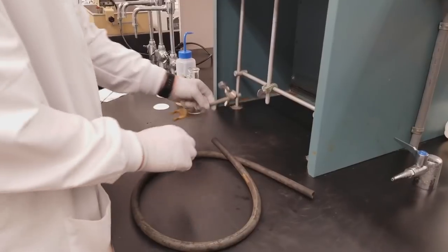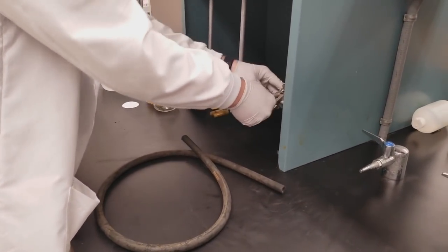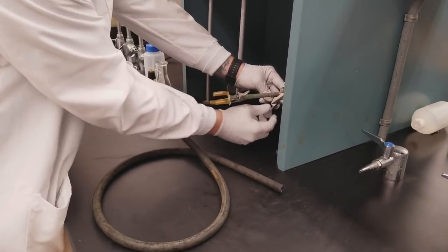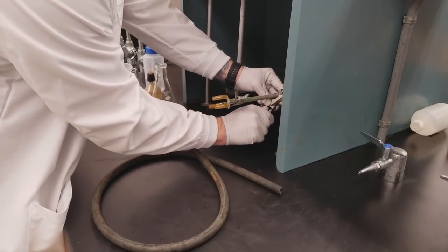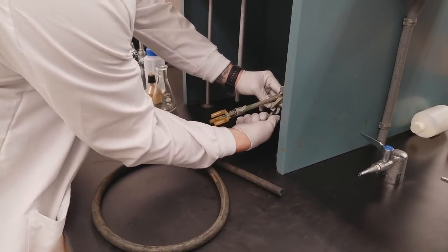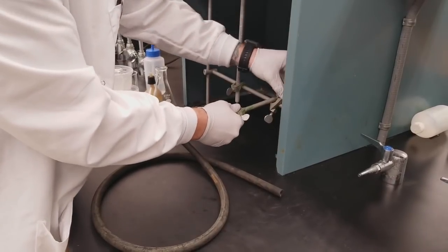We're going to begin by putting a clamp, attaching a clamp to our ring stand. That's going to secure our vacuum filtration flask so that we don't knock it over. So secure that, get it nice and straight.